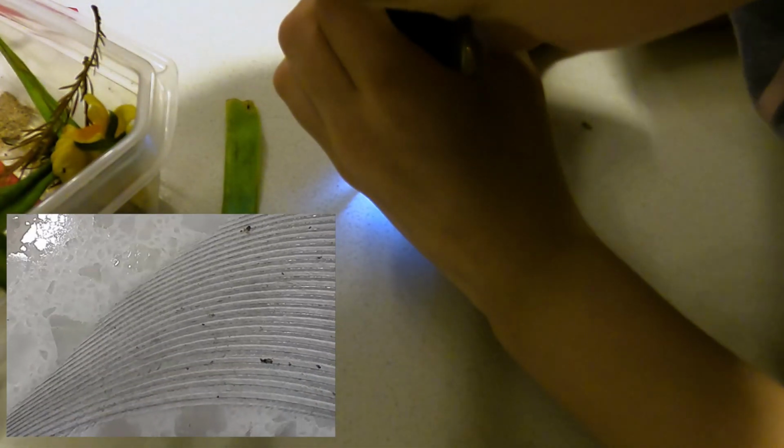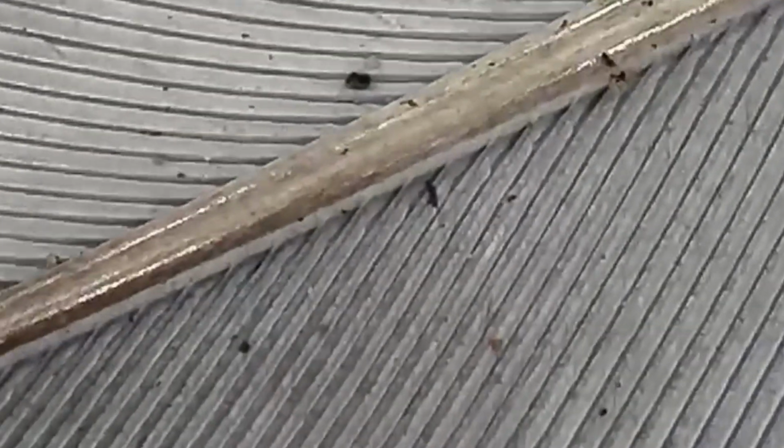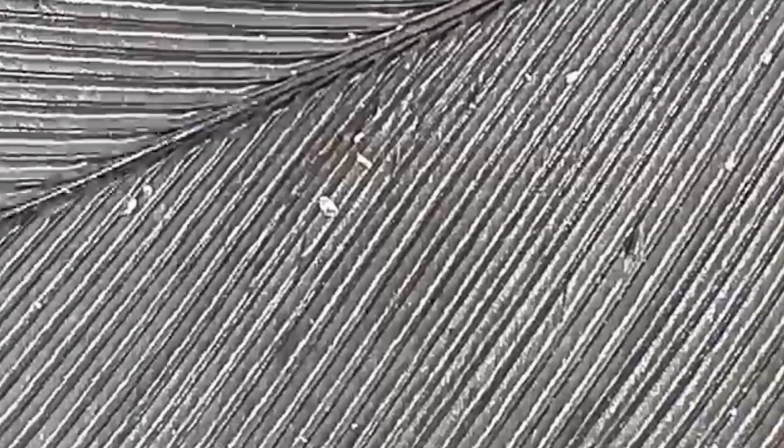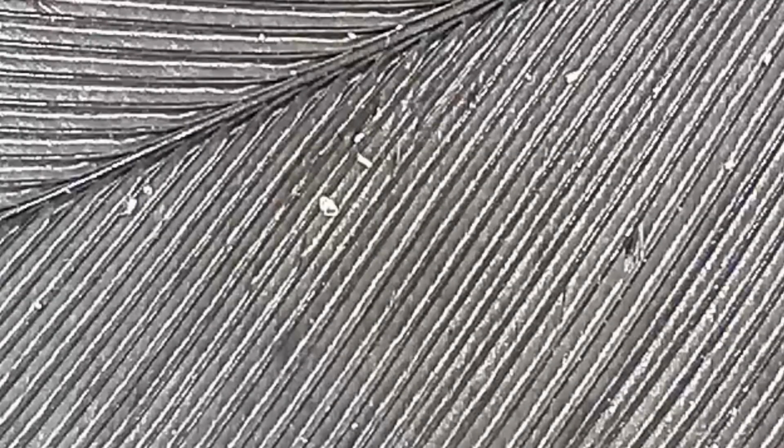So excited about this feather. Oh my goodness. Let me see. You know how you usually think feathers are going to be really fuzzy? It literally looks like sticks coming out of one of those really spiky branches. It's like a line here. I know. And one over, and then you have just a whole bunch of lines coming out. It looks like a stick. So you looked at the feather? Yeah, the feather just has... It's amazing. Line.